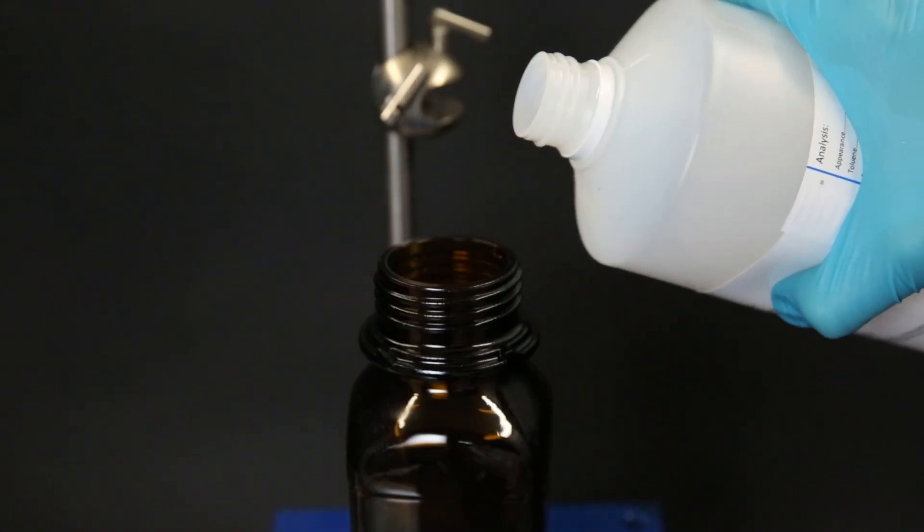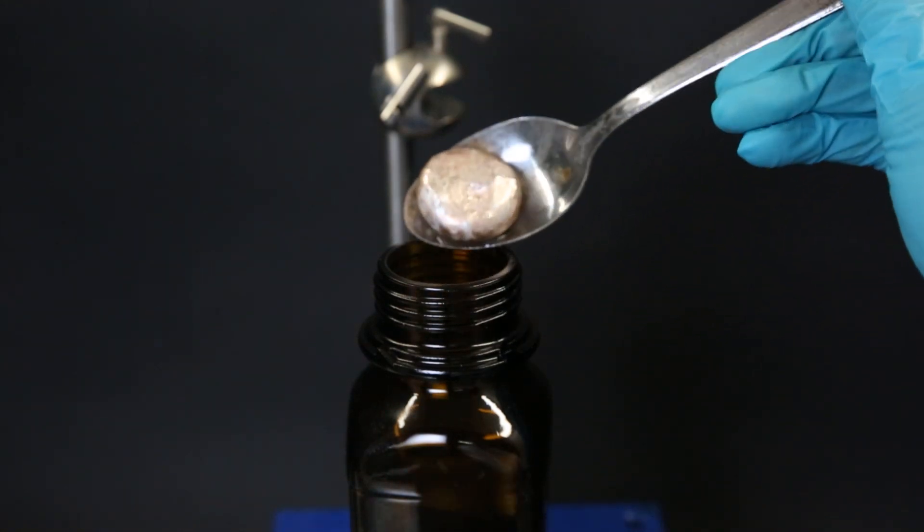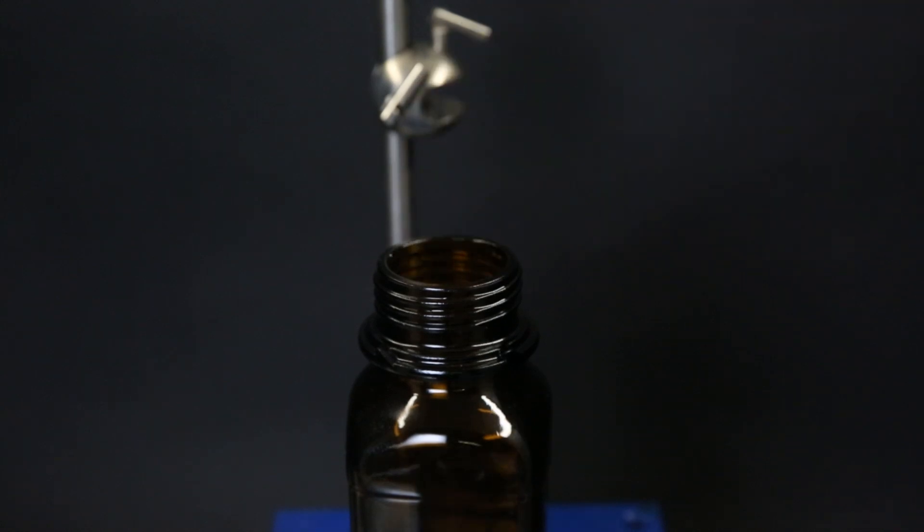So for storage I take a bottle and fill it with some toluene and simply scoop the sodium bead into the new bottle. We can see it instantly starting to tarnish in the air.